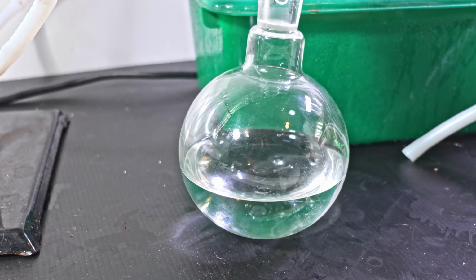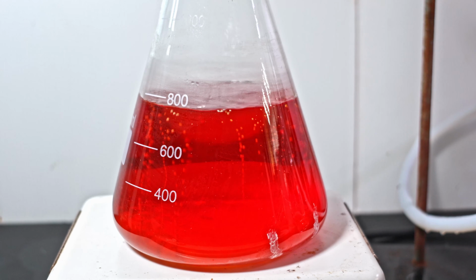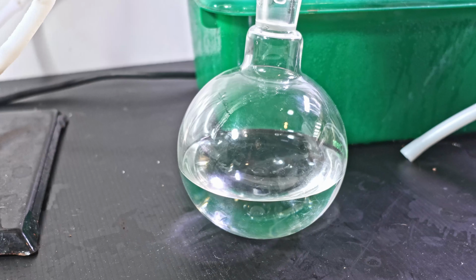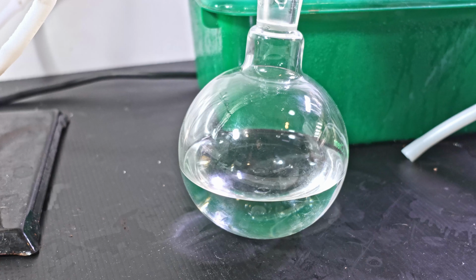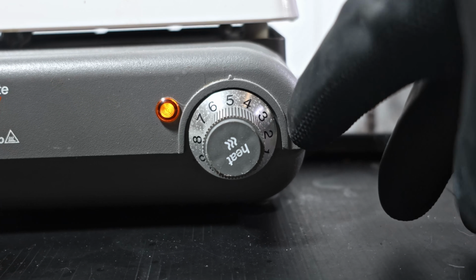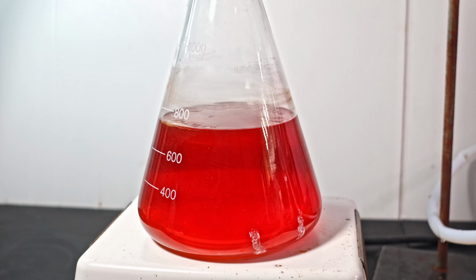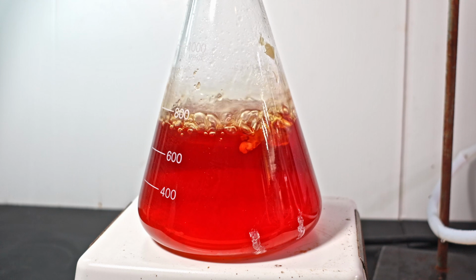I can't test it, however, because ethanol and methanol have really close densities, and my distillation head doesn't have a thermometer. It is, however, still touchable, so maybe methanol vapor is mostly flowing through there. Prior to vacuuming, I turned the temp down to 3 so I don't have another super boil. I fear I may have turned it down too far when suddenly it starts to boil.